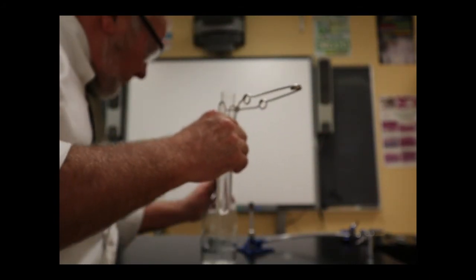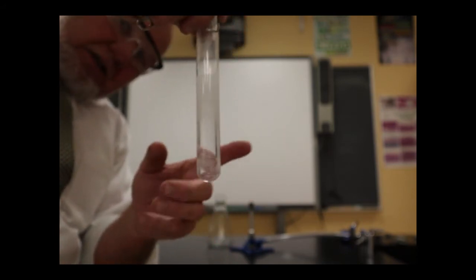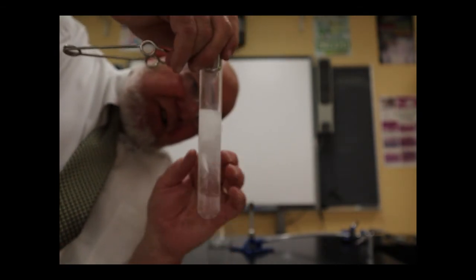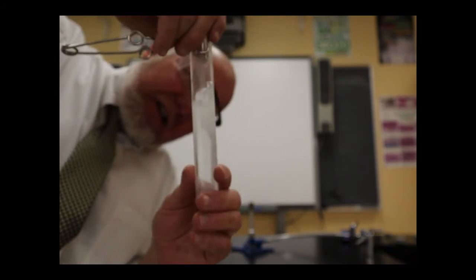All right, let's see if we can mix it up a little bit. Now I'm kind of holding it with my hand up here, but I'm just jabbing it, trying to mix it up. I still see bubbles there. What I'm looking for is evidence that the chemical reaction is complete. Once I don't see any pieces of magnesium, and the bubbles have all come out. The reason it's cloudy up here is because there's hydrogen, there's gas in the water.